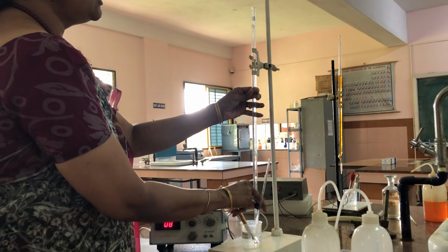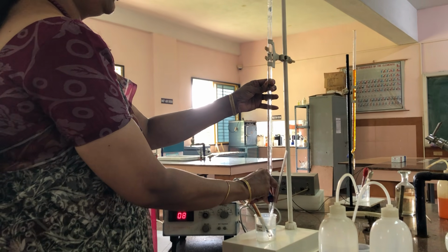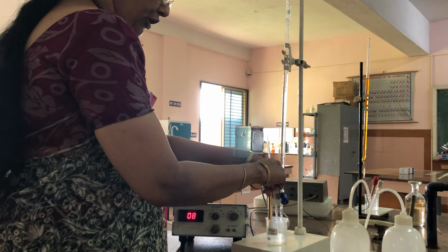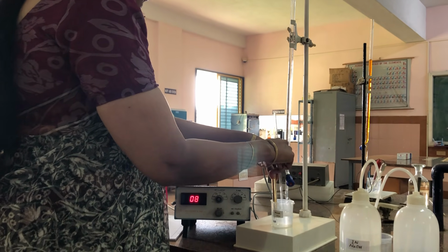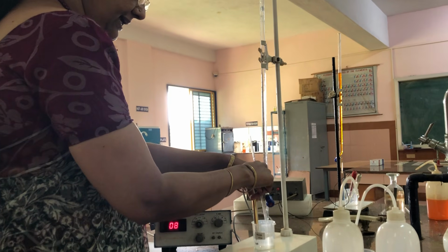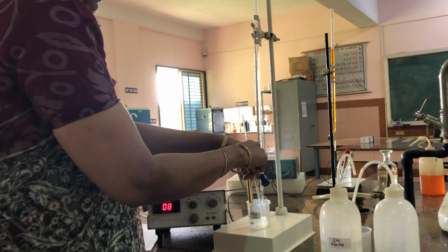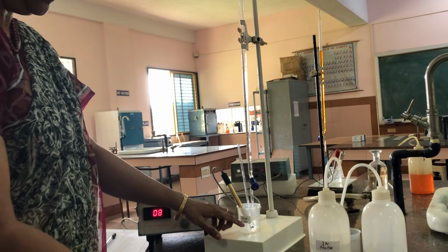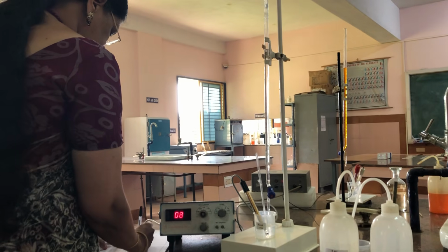Please think, many of the students will think that the conductance has to decrease continuously, but it will not be like that, because the conductance depends on the size of the ions and the mobility of ions present in the solution. That's why whatever now the conductance is increasing, that conductance is due to the OH minus ions which we are adding from the burette. Because the OH is not getting neutralized because there are no more H plus ions here. Now the conductance is 8.